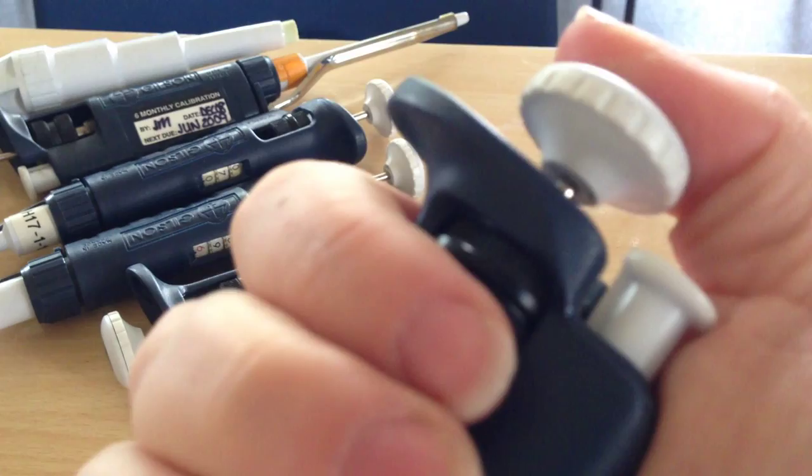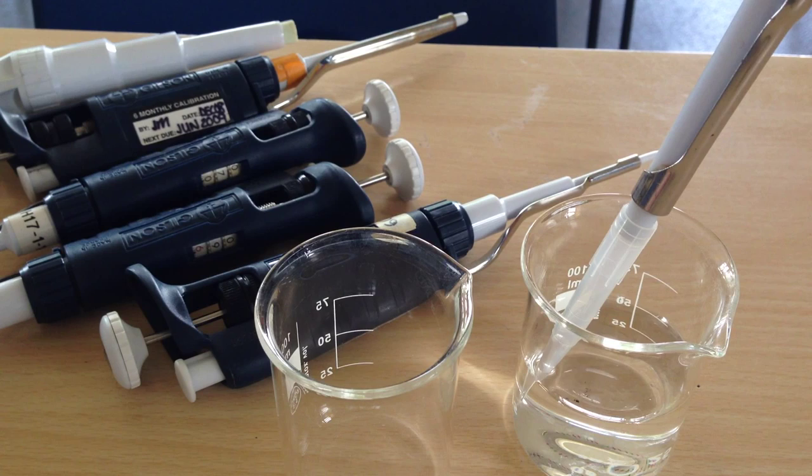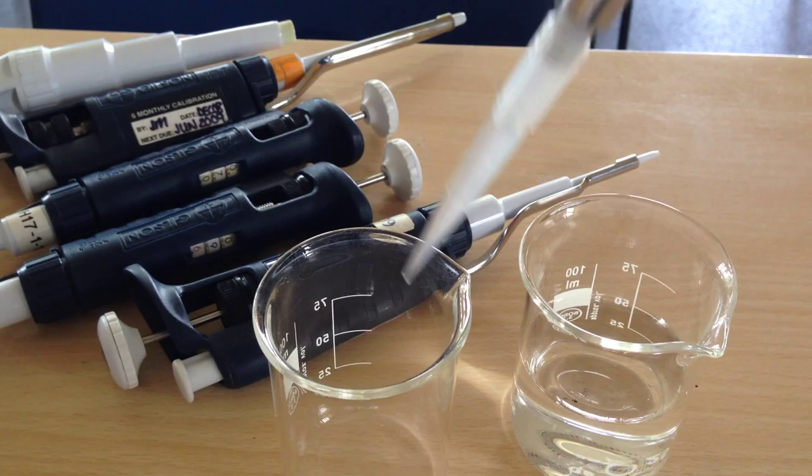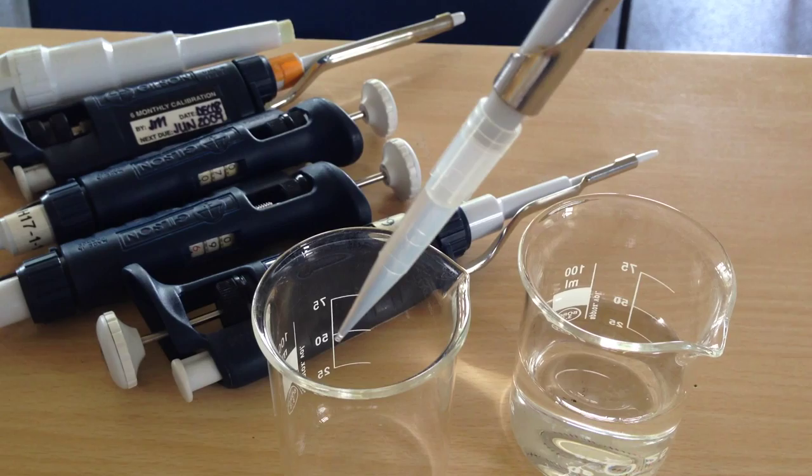So first of all I need to depress my Gilson to the first stop. Put the tip into the water and slowly bring it up. I can then transfer it, holding it pretty much upright.